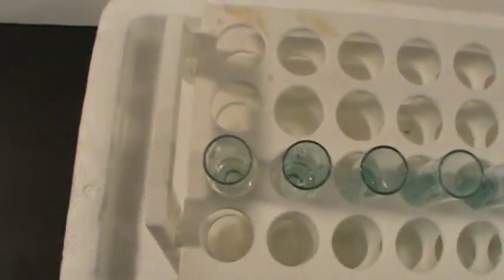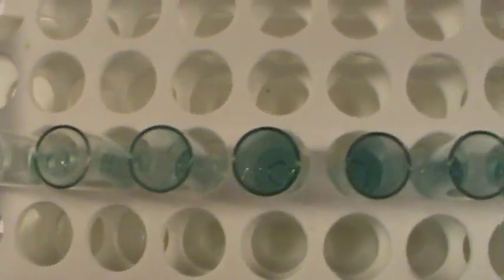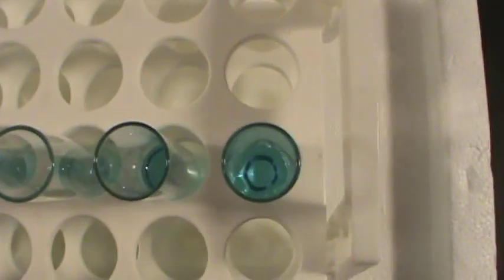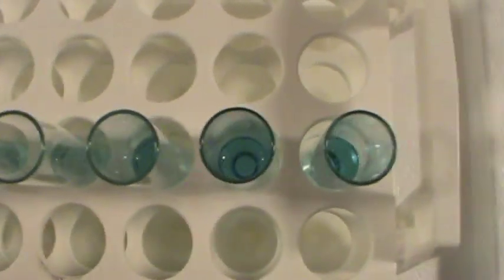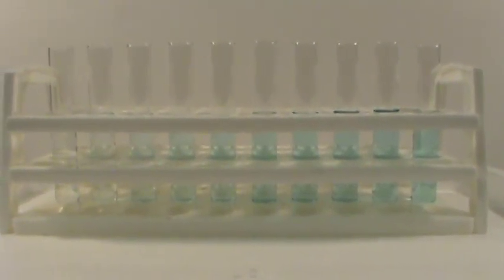And you can see that even down here on the end where there's very little color, it's a lot easier to see that that's actually blue because we're looking through a much longer path length. And as I go all the way over to the most concentrated sample, that blue color ends up getting pretty intense as we move down the row. So depending what we're trying to observe, it's always important to keep in mind that the path length and the concentration both determine the color of a solution.